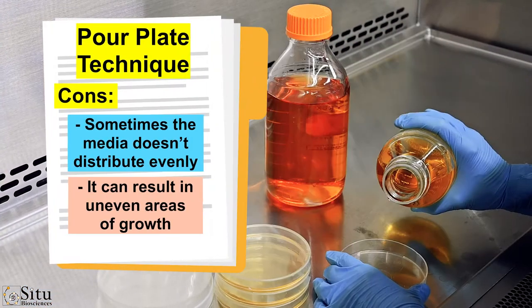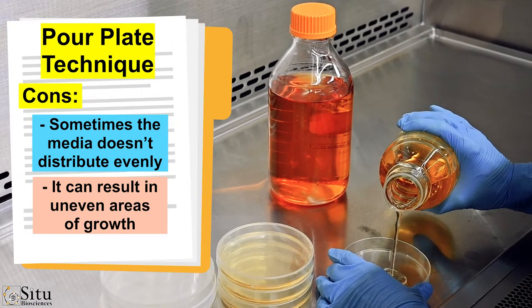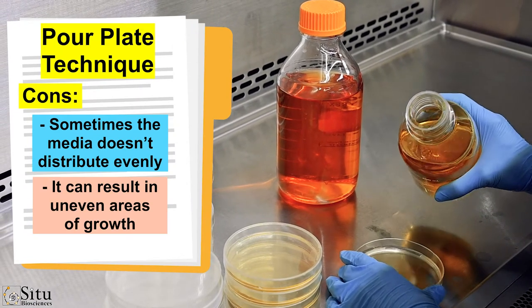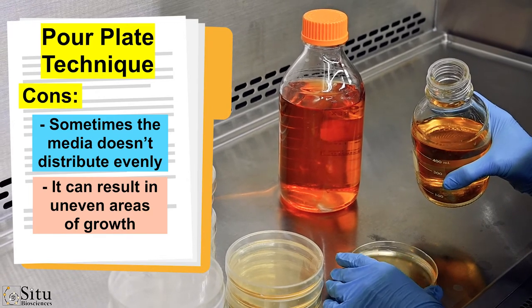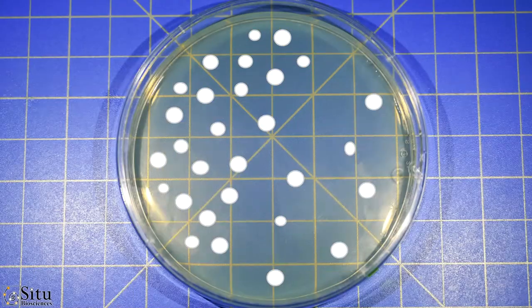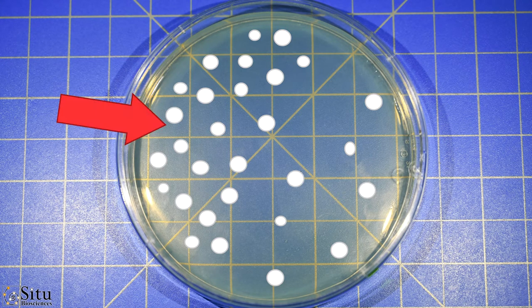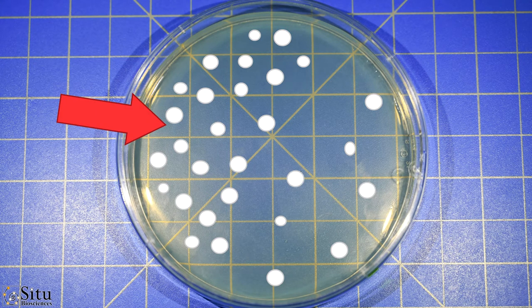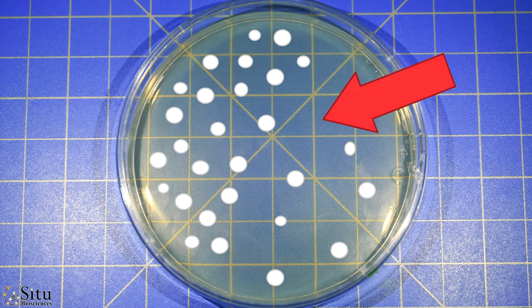One prominent issue with this technique is that sometimes, when mixing the inoculum and agar in the plate, the media doesn't distribute evenly, which can make things more difficult when it grows. This is because it can result in some spots on a plate with more pronounced areas of growth and other spots with a dearth of growth.